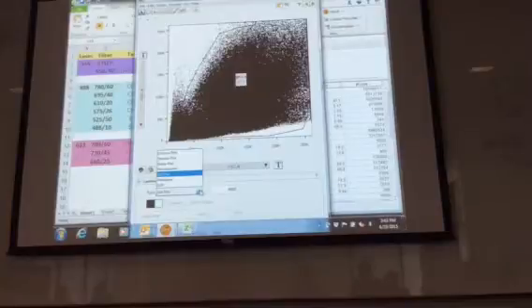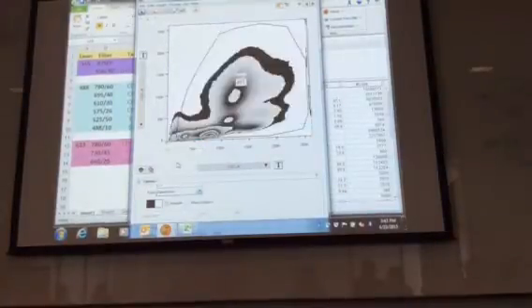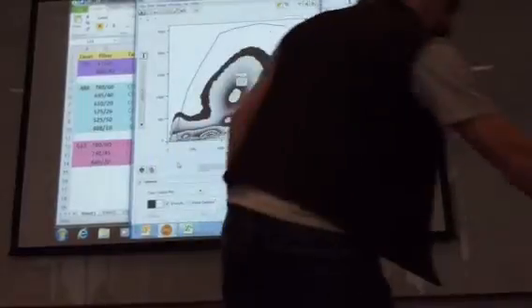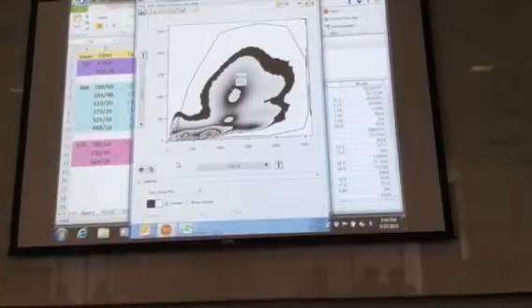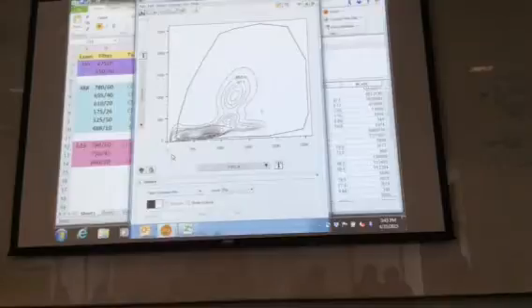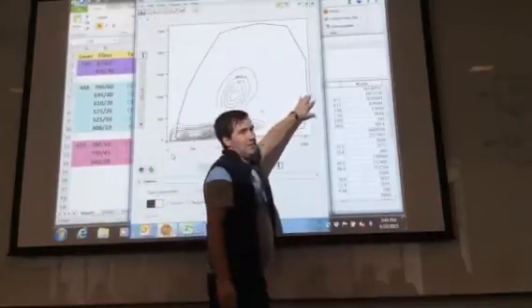What if this is going off the screen? How do I know what to select, do I just select all the way over to the edge? Typically, you wouldn't want to go off the edge like that. This is a zebra plot or whatever. If you look at a contour plot, this is where the majority of all your cells are. So typically, no, I wouldn't go all the way to the edge.